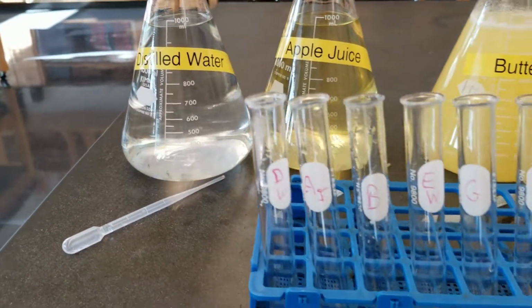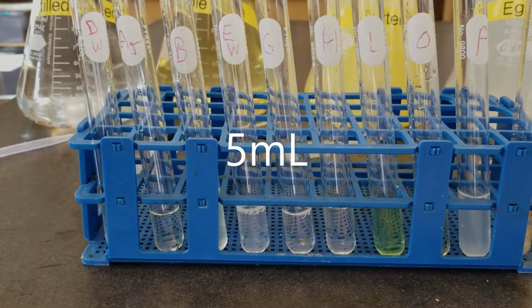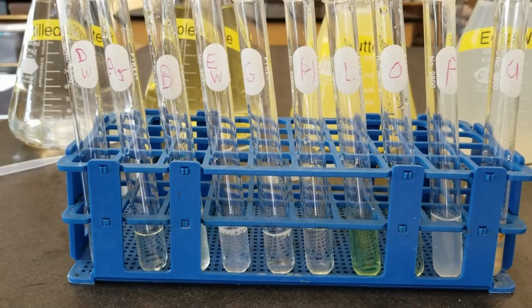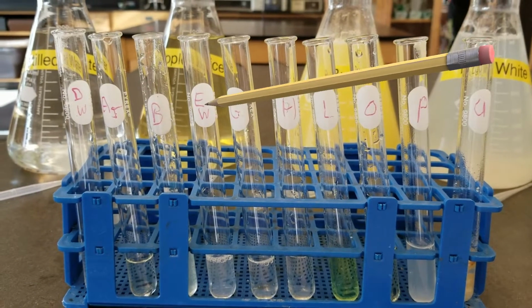For every single one of these procedures, we will distribute approximately 5 milliliters of the liquefied food into a clean test tube. Every one of our test tubes is labeled with the abbreviation.